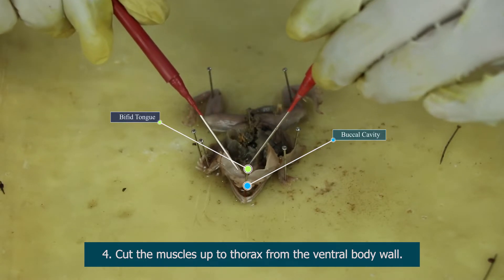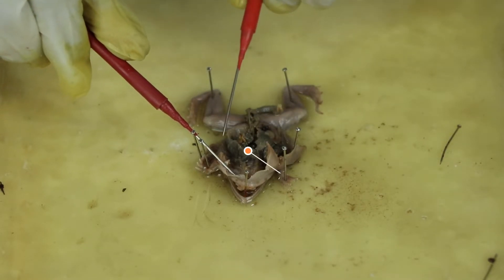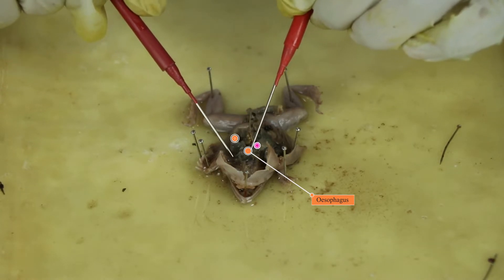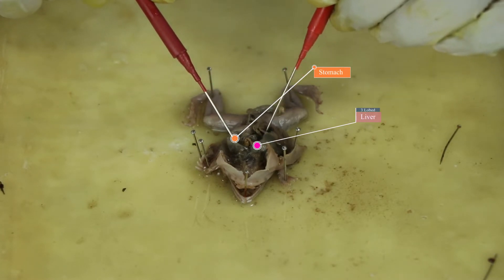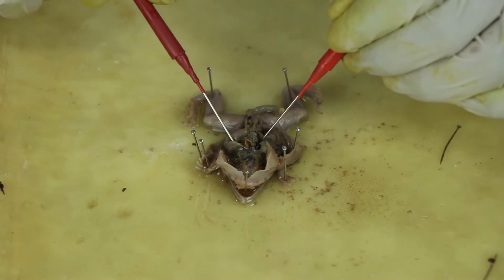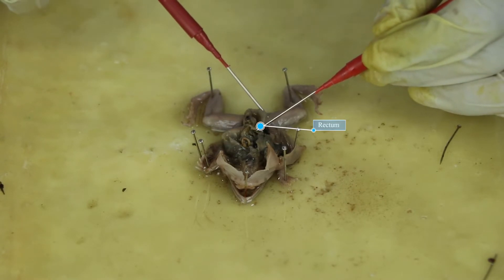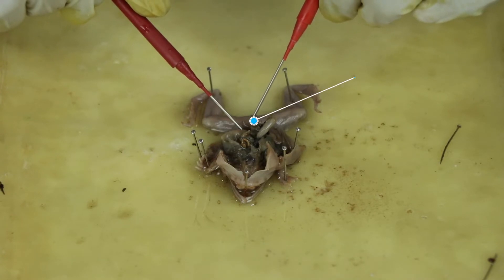After going down into the system, we see the esophagus. On the right side of the system of the frog, we see the stomach, and around it we see the three-lobed liver. After uncoiling the intestines of the frog, we see the rectum and the anus, which leads to the cloacal aperture right near the end of the system.